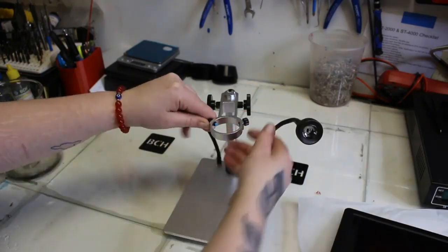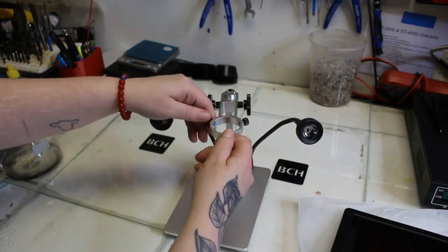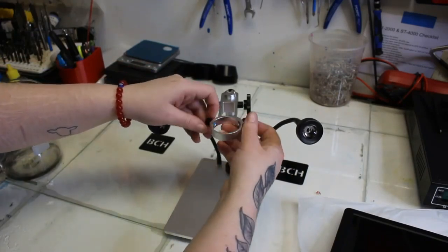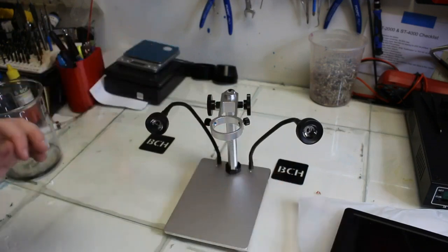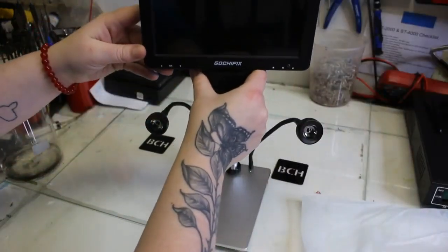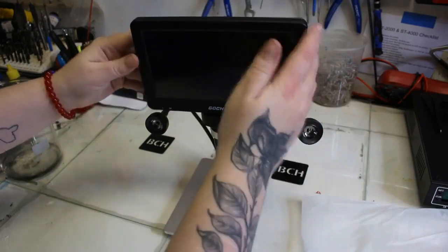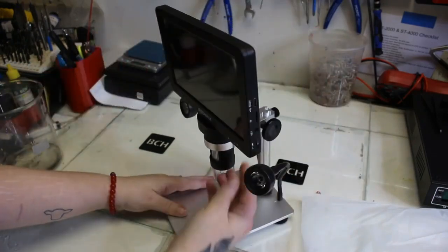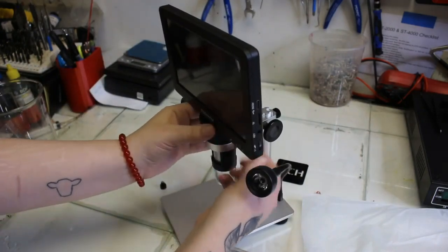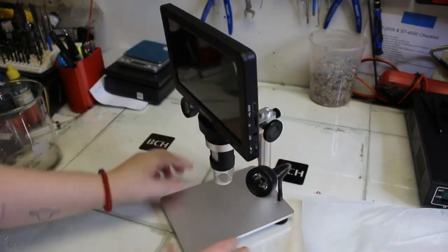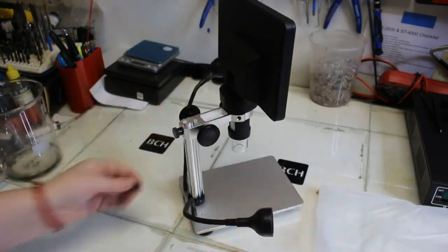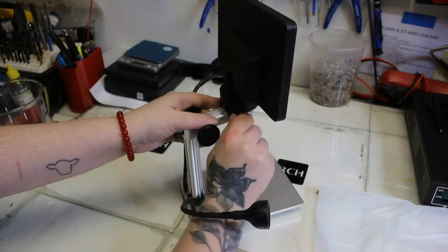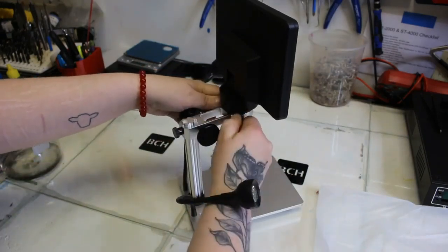The second thing we needed to do was put the actual microscope into the stand so you'll see that there's these two screws and on the end of the screws there's blue rubber tips so when you screw it into your microscope to hold it it's not going to bust up your microscope. I have it in there and now I'm going to screw my two screws back in tight just to hold my microscope so it doesn't flop around when I try to view things or move it.